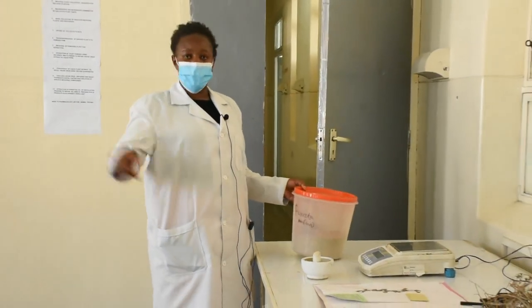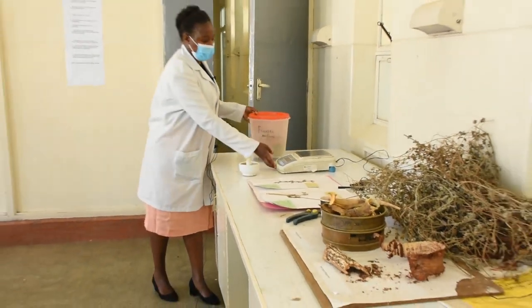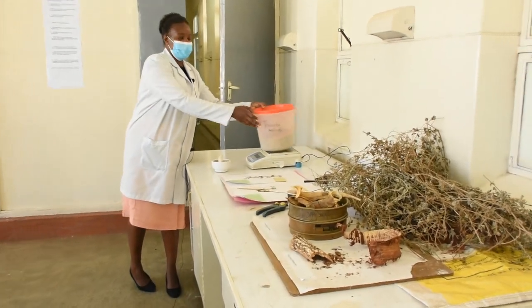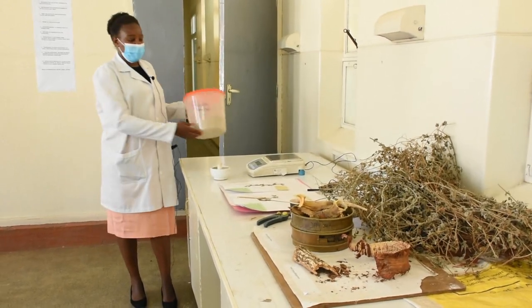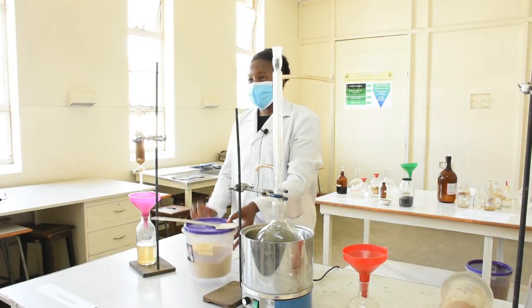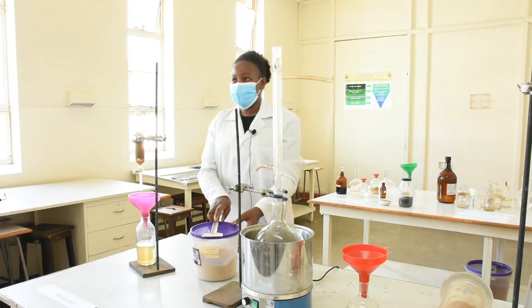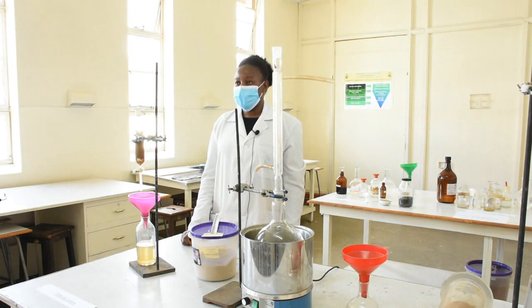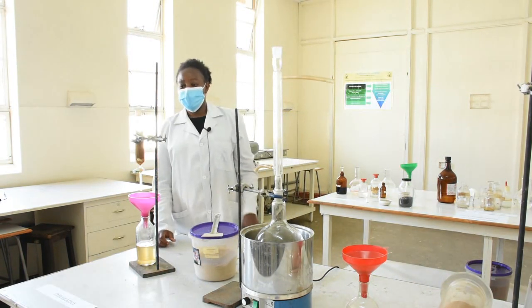To extract, we first weigh the plant material on a weighing balance to get our starting point — so many grams or kilograms of plant material — which we then expose to an extracting solvent. Our dried powder sample is weighed, so we have our starting weight, and we can take it through extraction using various methods depending on the nature of the phytoconstituents. The first method is percolation.